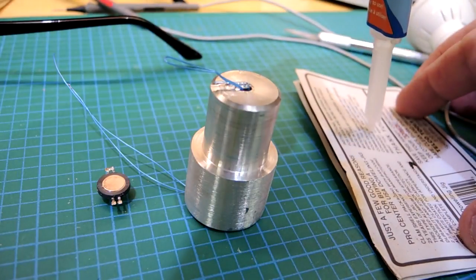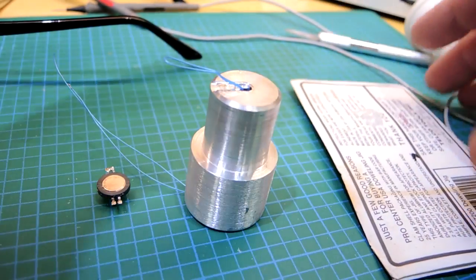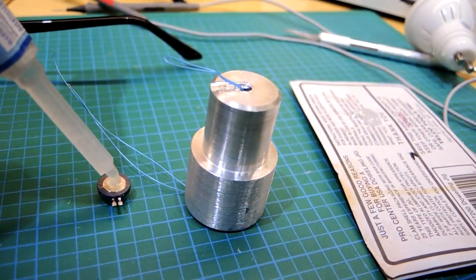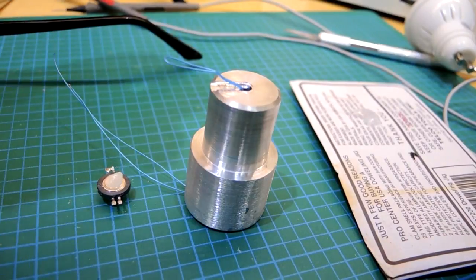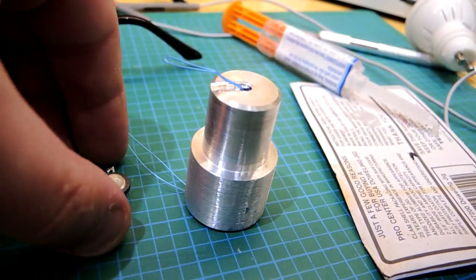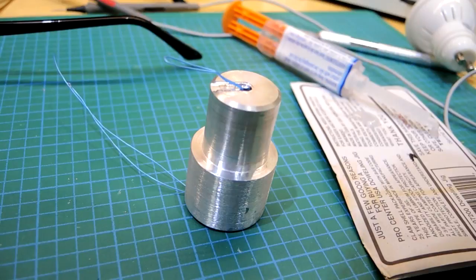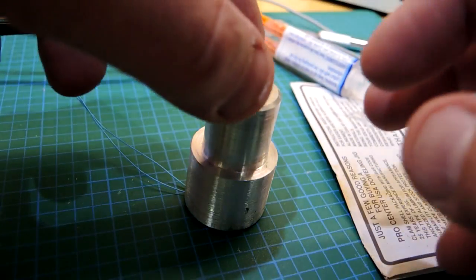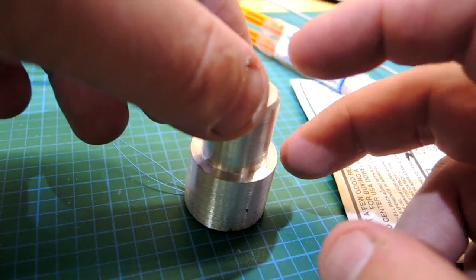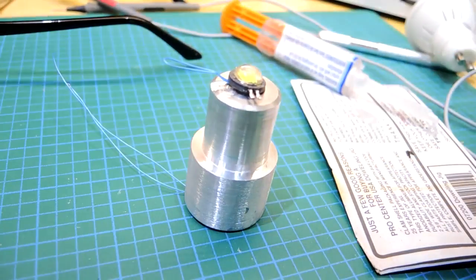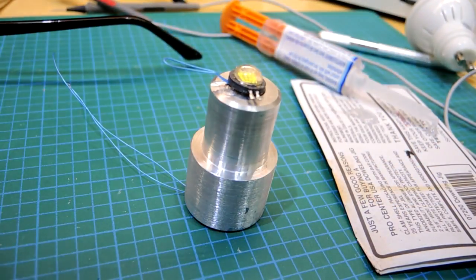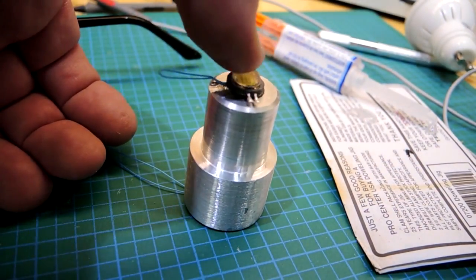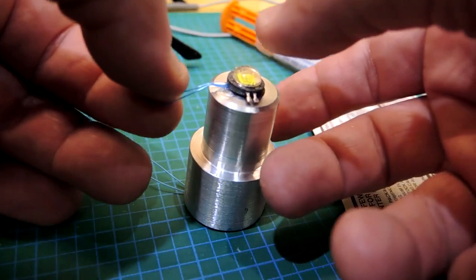Next stop was to get the LED attached to the metal. Thermally conductive epoxy probably would have been the best but I just had a little tube of inexpensive regular epoxy. Not a super thermally demanding application though, so I just attached the LED to metal using it resulting in this arrangement here which is almost complete.